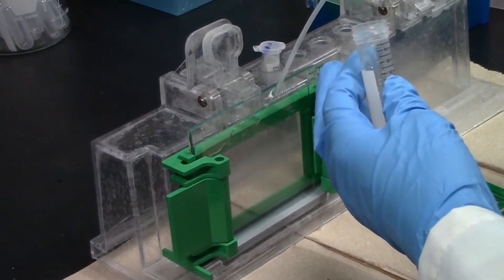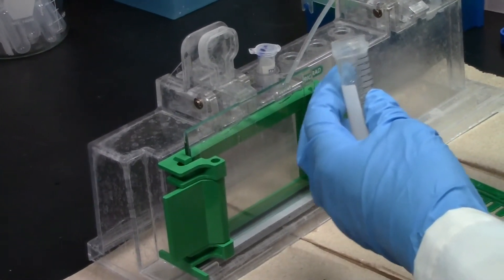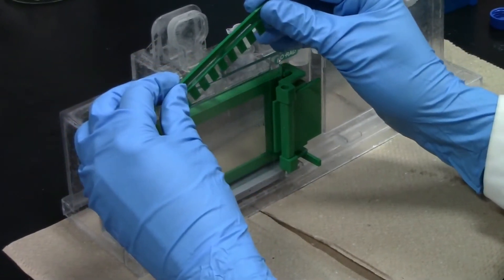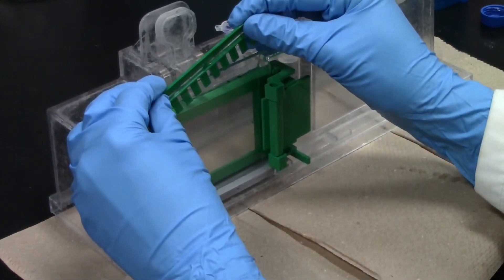Finally, insert the comb at the top. Remove any overflow gel solution using the pipette or by wiping with a Kimwipe.